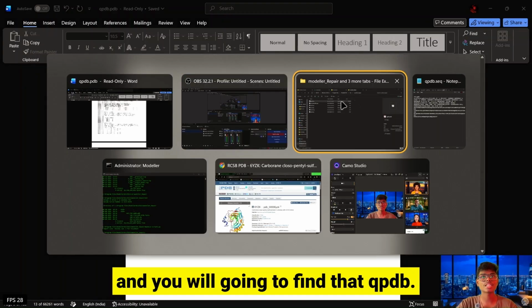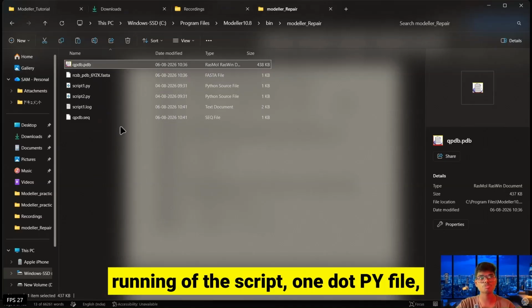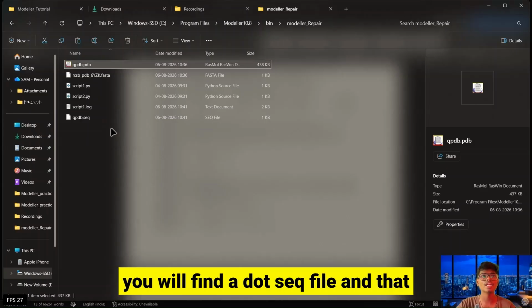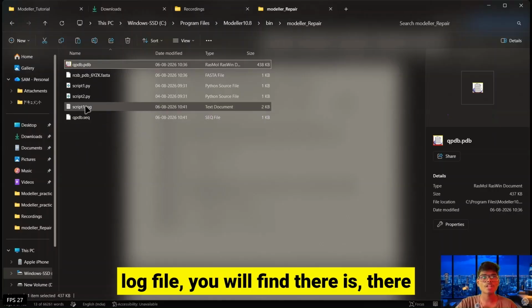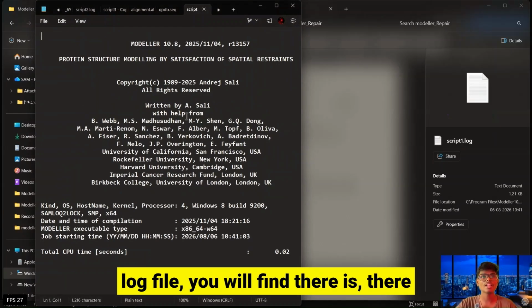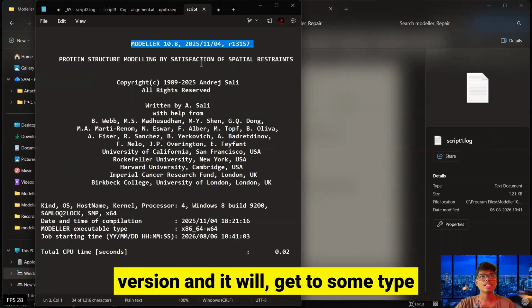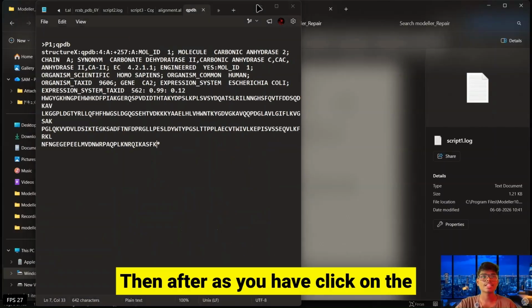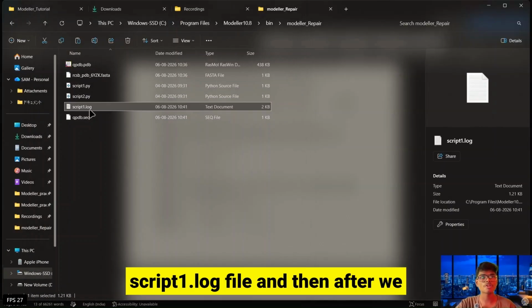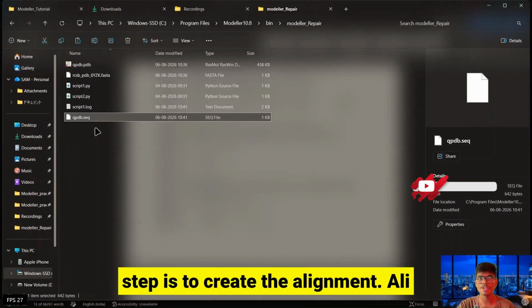After visualization, after the successful running of the script1.py file, you will find a .seq file and also a log file. When you open the .log file, you will see modeller 10.8 and its version, and it will give you some insight and information. Then, as we have opened the script1.log file and got the qpdb.seq file, the next step is to create the alignment.ali file.